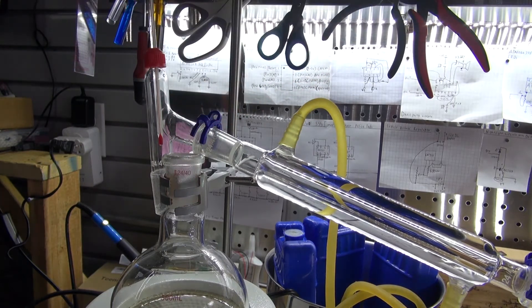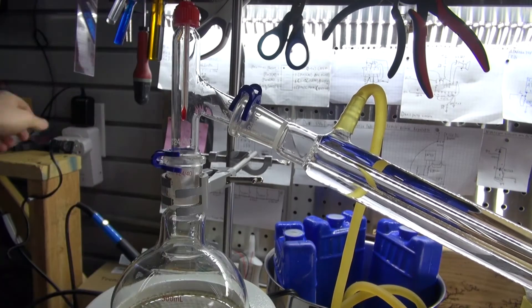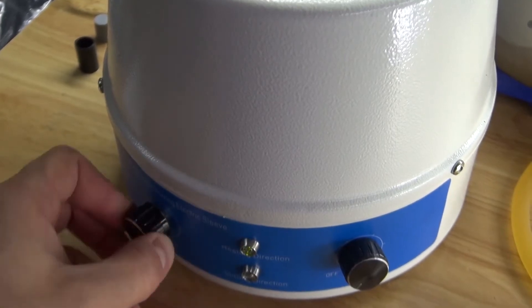There we go. Now connect everything back together. Plug in my water pump and go to my heating mantle and crank up the heat to maximum.